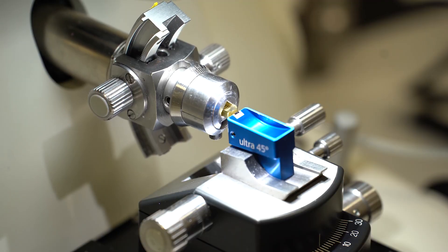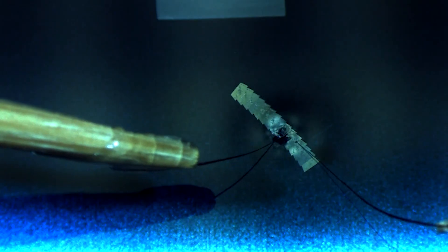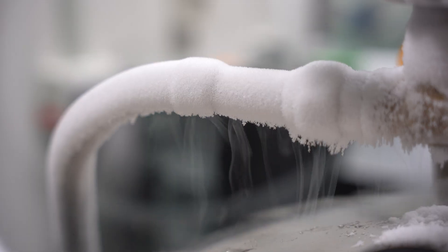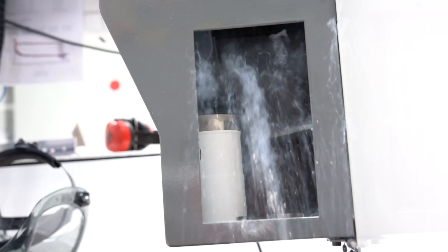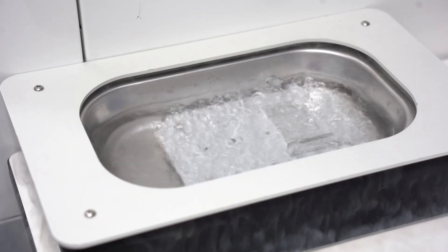We have to cut the resin block extremely finely — the only thing sharp enough to do that is a specially sharpened diamond. Those sections then have to be moved around water and separated, and that's done by something very cheap: our own eyelash stuck to a cocktail stick. There is another way to prepare samples: cryo stabilization. We freeze the sample incredibly quickly — about a million degrees a second — from a liquid state into a glass-like solid state.